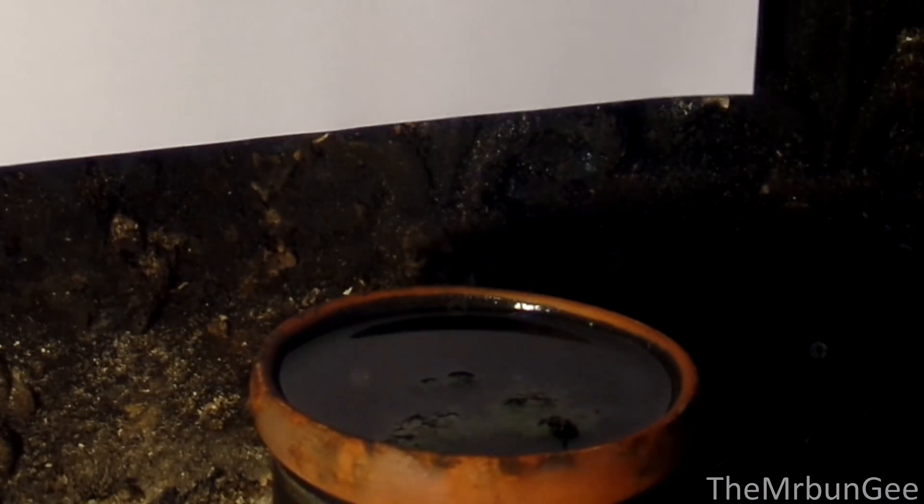Now I'm making it the old-fashioned way with rough potassium permanganate crystals. You can see the green oily liquid floating on the top of the acid.